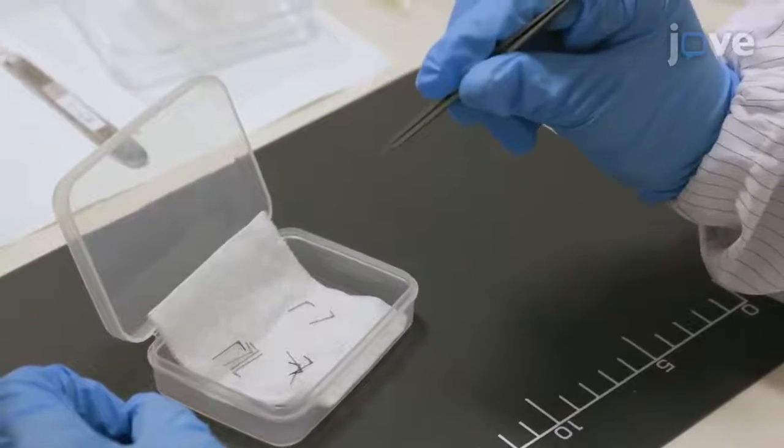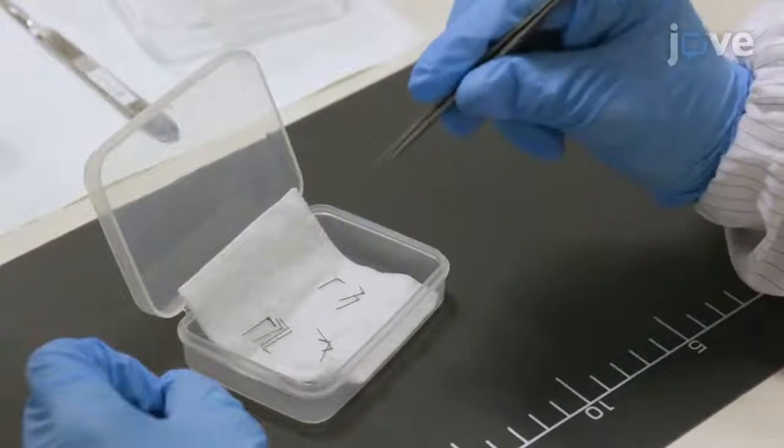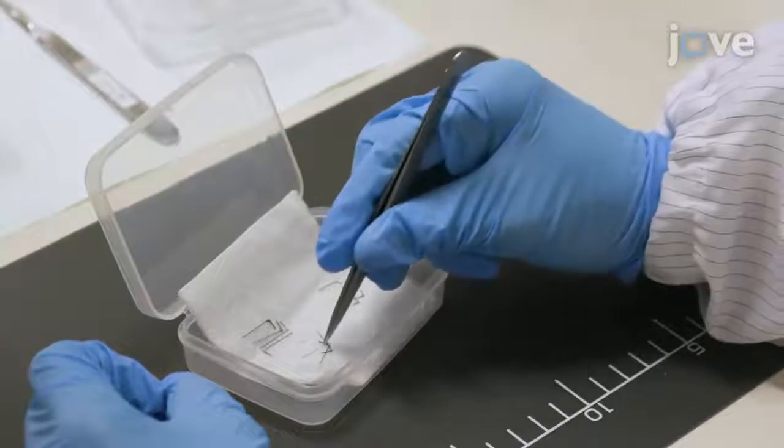As a first step, etch the pins. Begin with degreased 0.3 millimeter thick L-shaped stainless steel pins of different lengths.